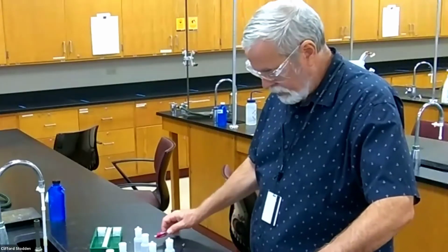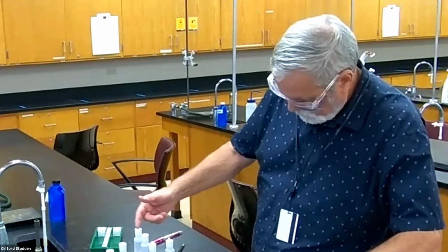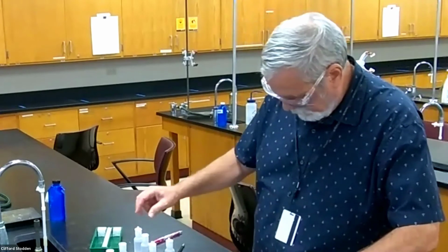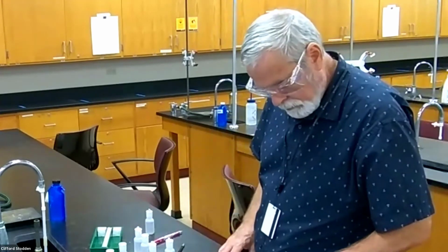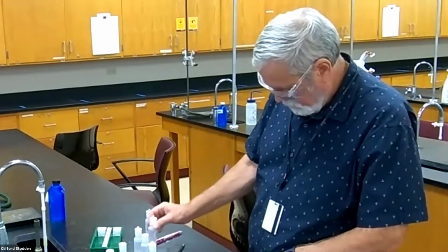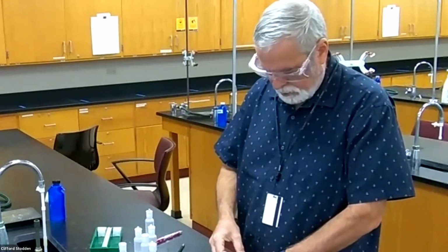Now, silver nitrate. Remember, we've done a lot of these already. So with silver, we only have 4 of them left to go. First one under the silver would be hydrochloric acid. Definitely expect something to happen there. This chloride is insoluble.